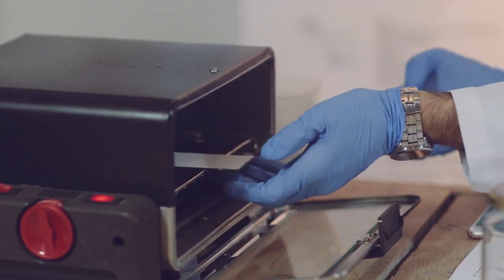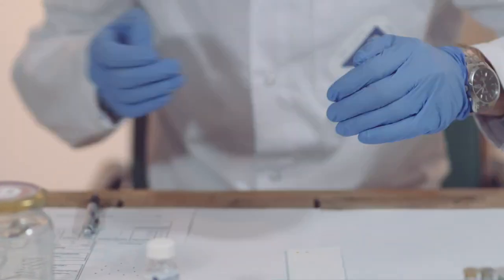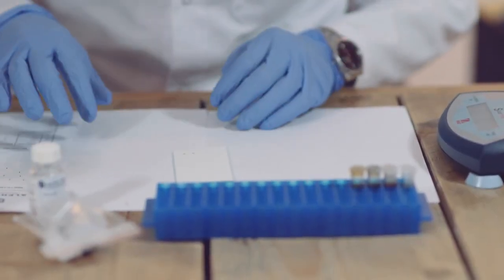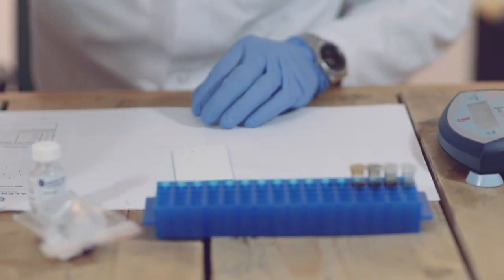When the time is up, remove it out of the oven. The plate is hot, so be careful when handling. Let it cool for 30 seconds.